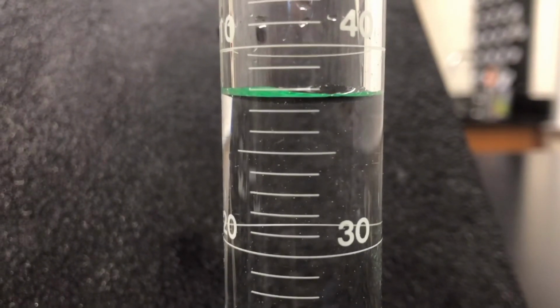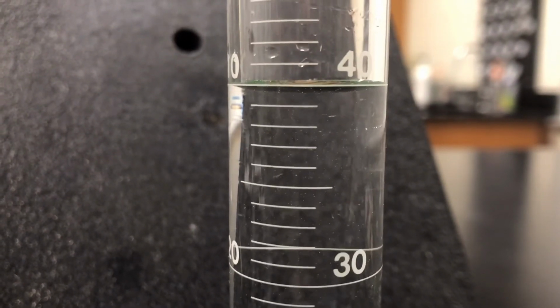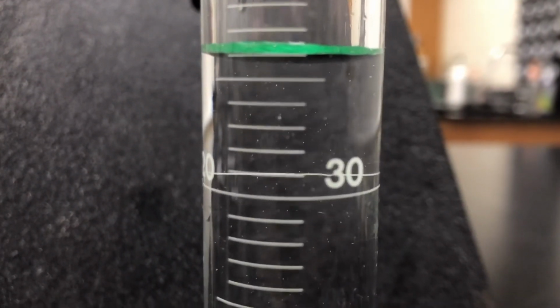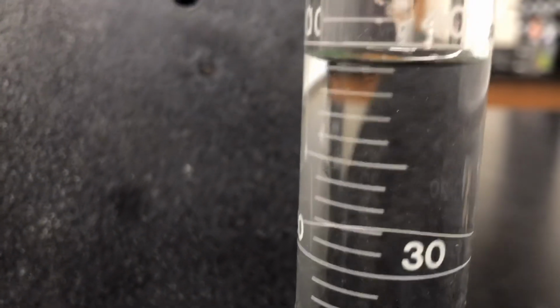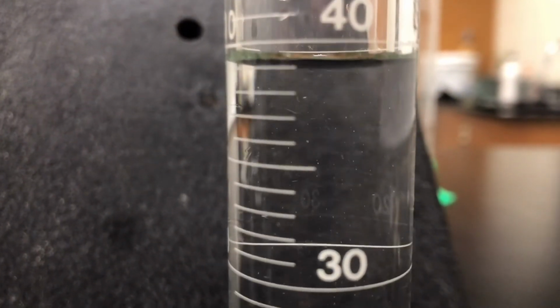1988. Right there. 1989. So this is our beginning meniscus right there. Tell us what you got. 1989. Our total volume has gone up to, there's your 40. Get down here reading that pretty even.